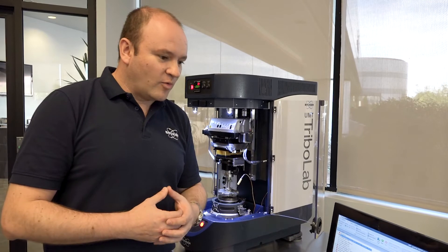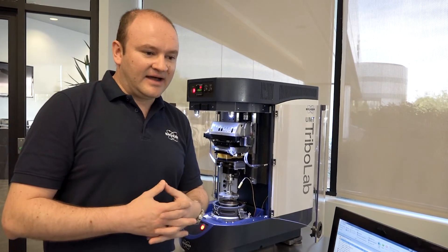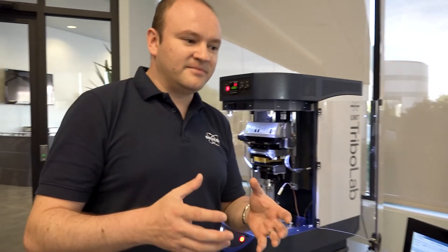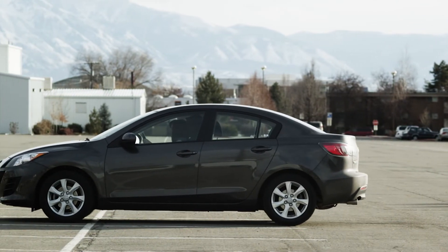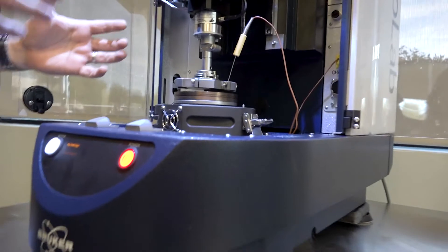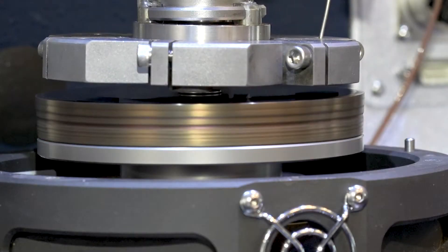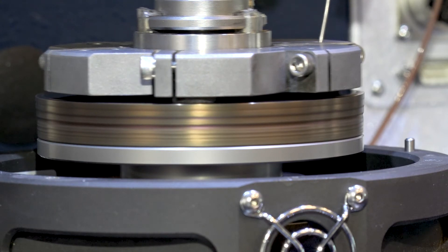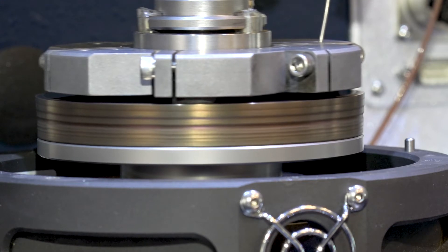I will simulate one of the deceleration steps that basically simulates the automobile going from 80 km per hour all the way to 30 km per hour in a certain period of time. After getting the full speed of the rotor simulating 80 km per hour, we are going to simulate the braking condition again and again in the same way that the industry standards are programmed.